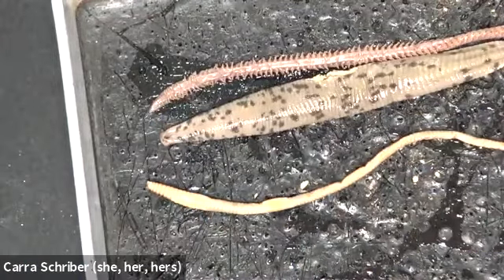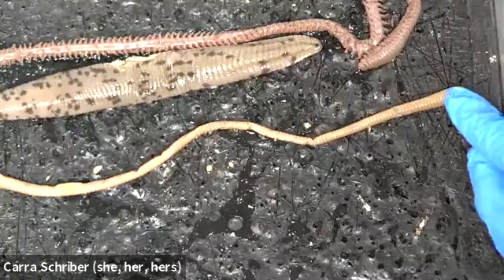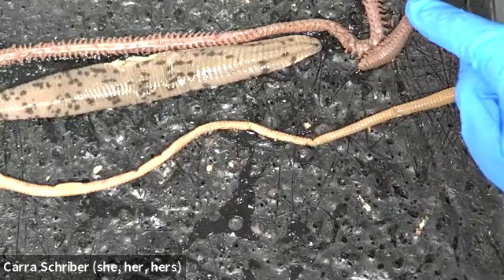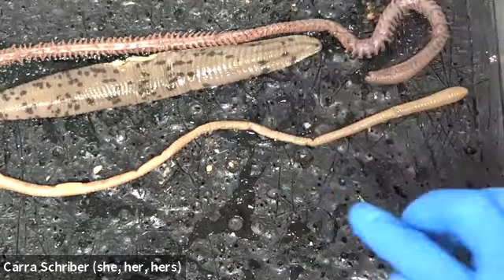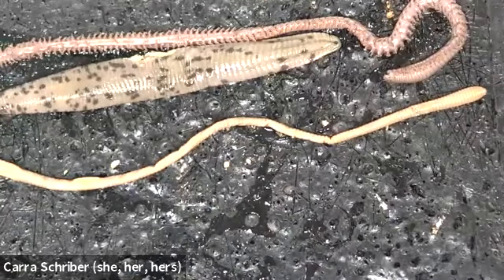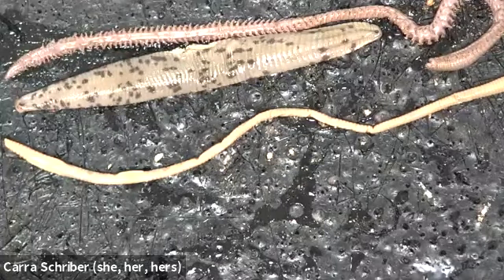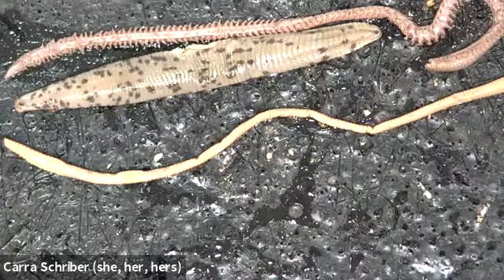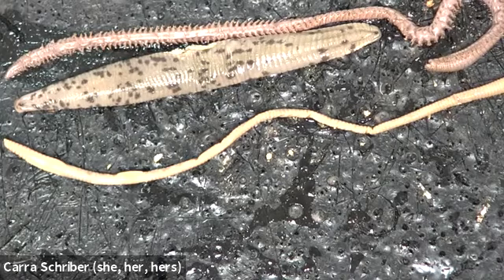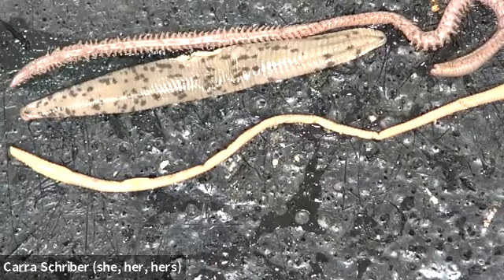I'll do an earthworm dissection here in a little bit, but we're just going to look at the specimens here first. And I think you can see it really clearly here, each of the different segments of each of these different body types. So all of these are segmented worms. And segmented worms are true coelomates, meaning that they have a true coelom formation. And when we have true coelom, that space where the coelom is and there's communication between all 3 of our different tissue layers, we have pretty complex organ formation in response to that. So let's take a look at what that looks like underneath the microscope.